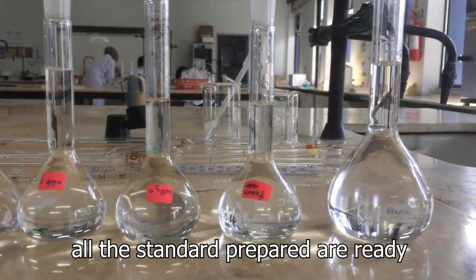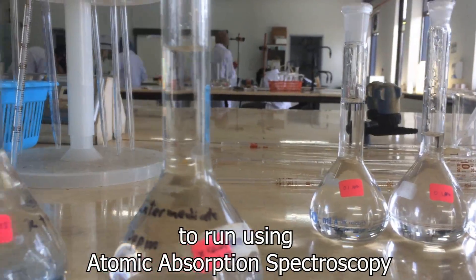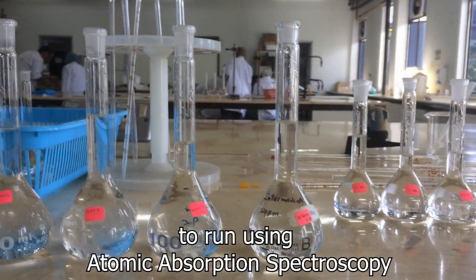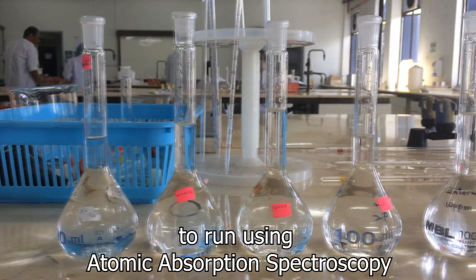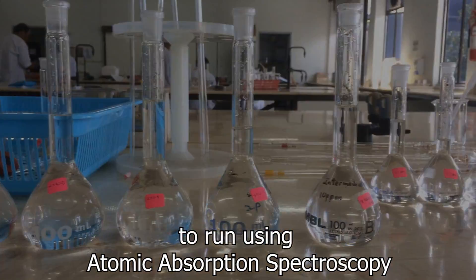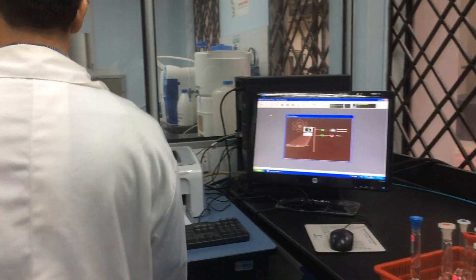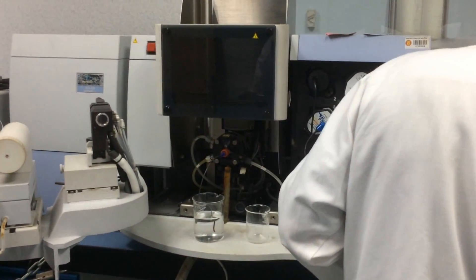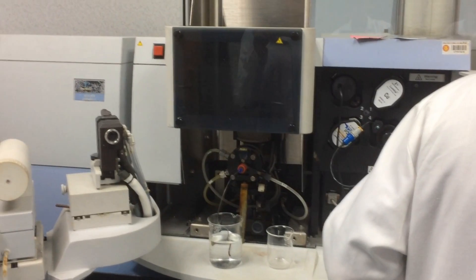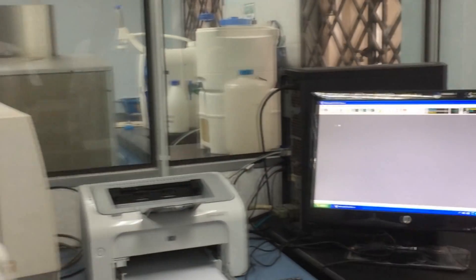All the standard solutions are ready to run using Atomic Absorption Spectroscopy (AAS).